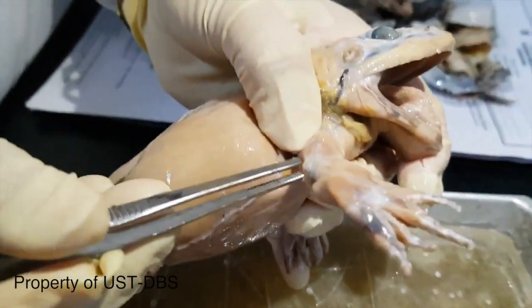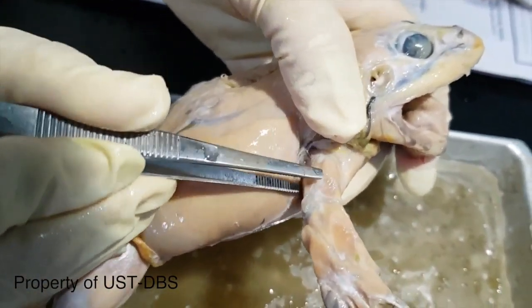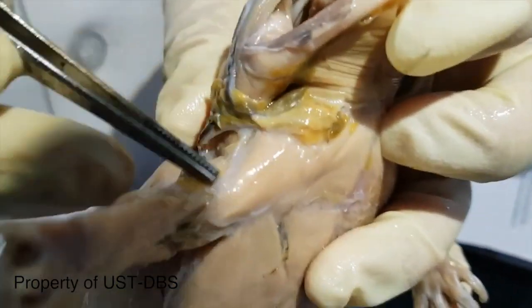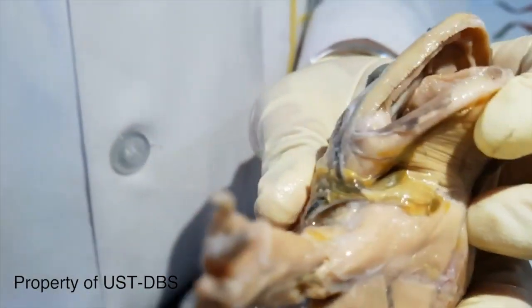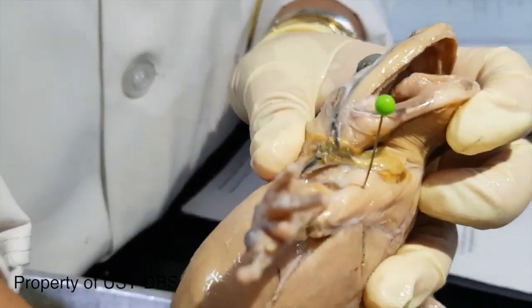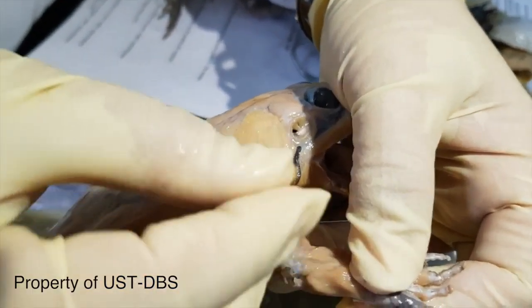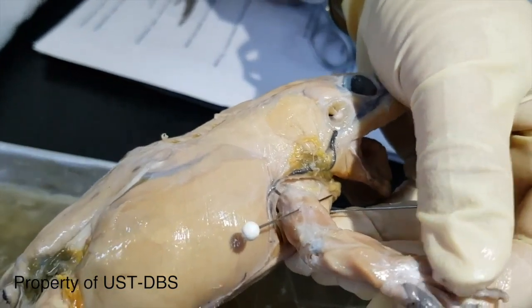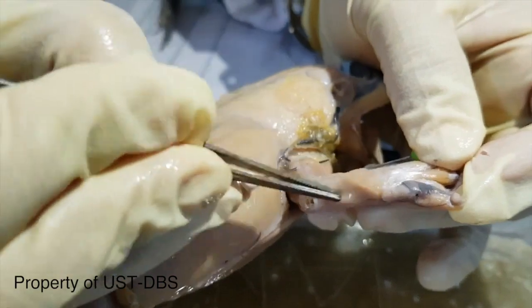Okay, so muscles of the upper arm, dorsal side. This muscle here is the triceps brachii. This is the shoulder muscle, triangular in shape, the deltoid. Then these two muscles here on the arm are the triceps brachii. Okay, so this is the ulna side.